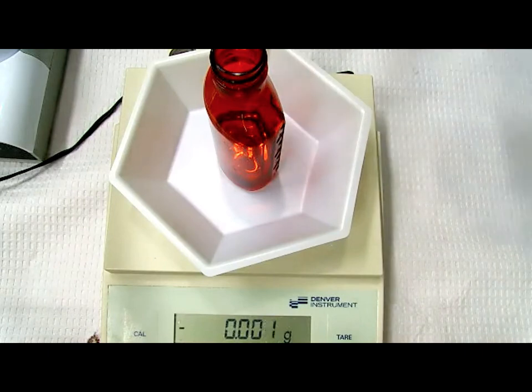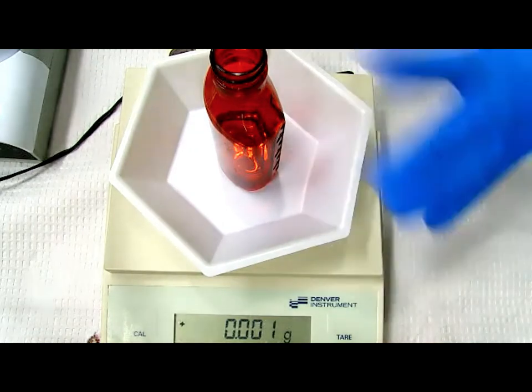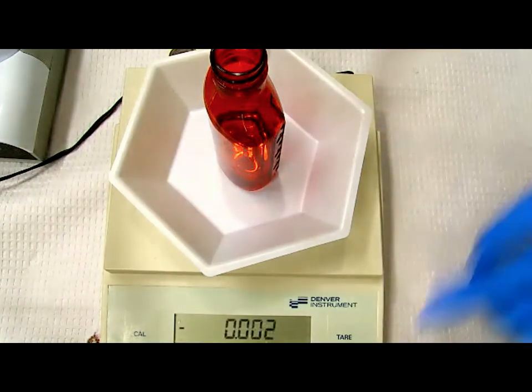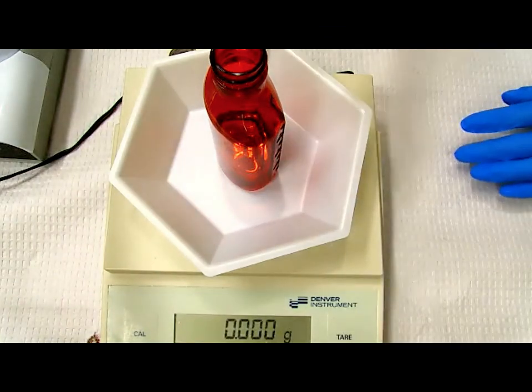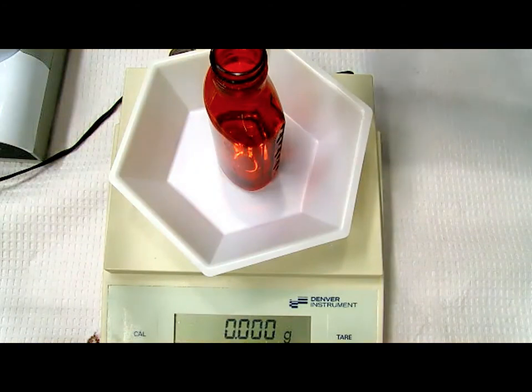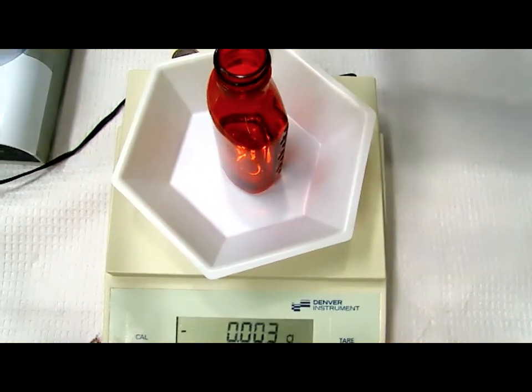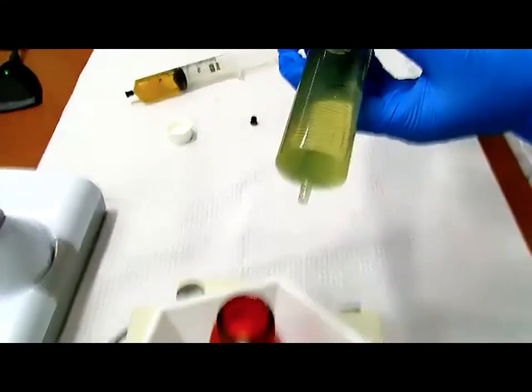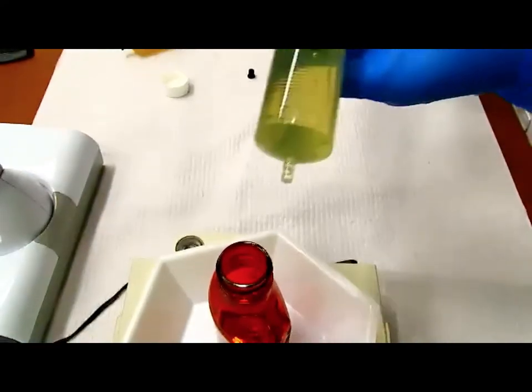Right, so I am going to measure 1.6 of this directly. So I'm going to place the bottle. Usually I place a weigh boat there in case I spill, so it collects the spill. And you want to tare that so we can measure the weight of this liquid directly. As Larry said, you can measure liquid by volume, but there's also another way to measure liquid by weight. Okay, so we're going to add it here.